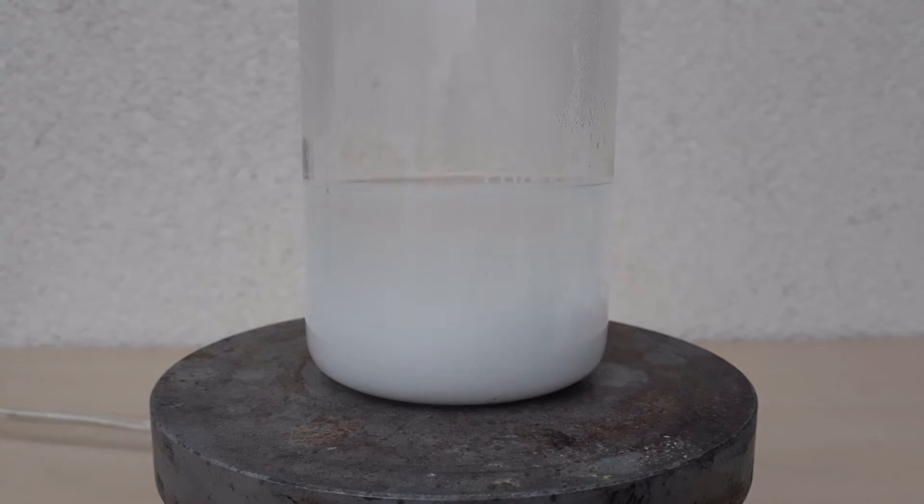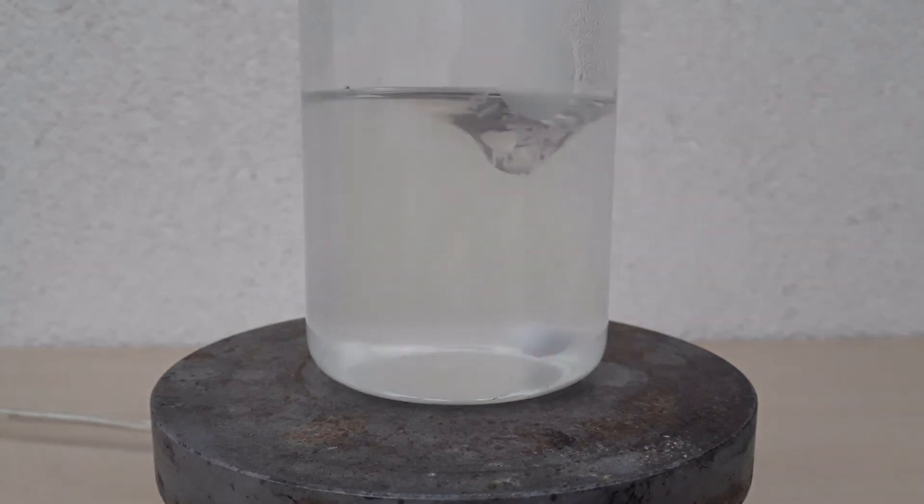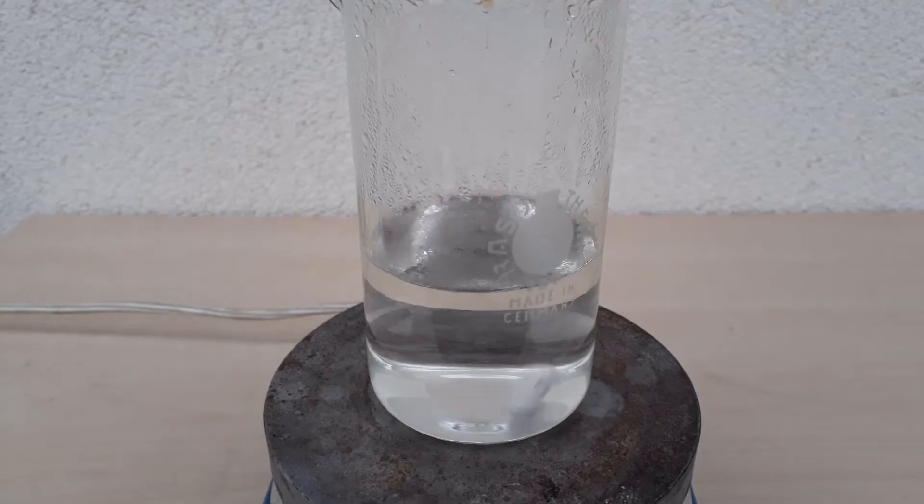It took about 5 minutes, but all the solid dissolved in the end, and after that I left it boiling until I saw a crust of solid forming on the surface of the solution. At this point I removed it from the hot plate and let it cool down.